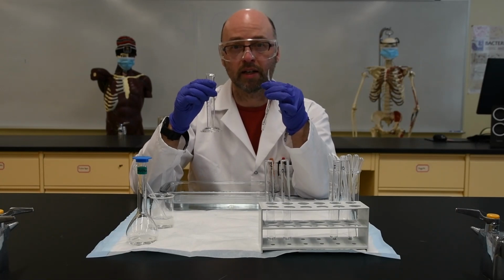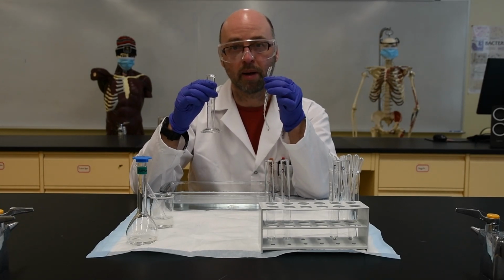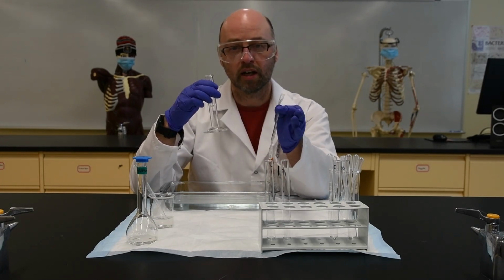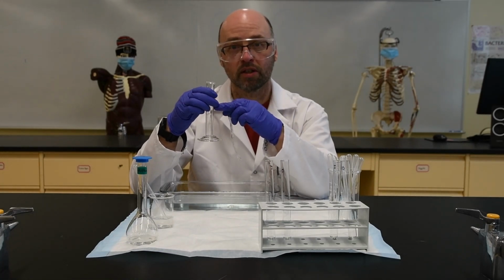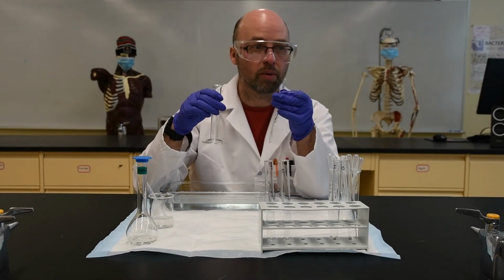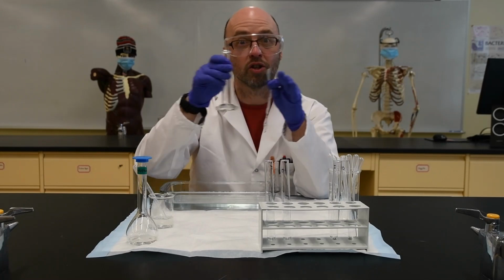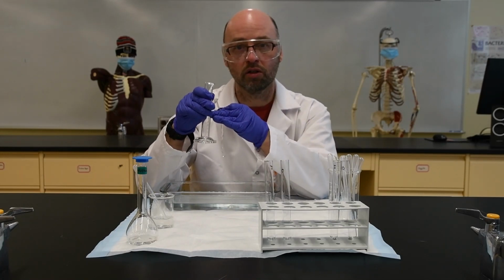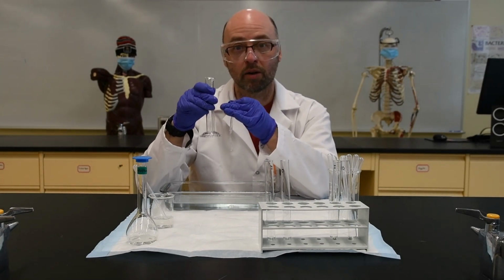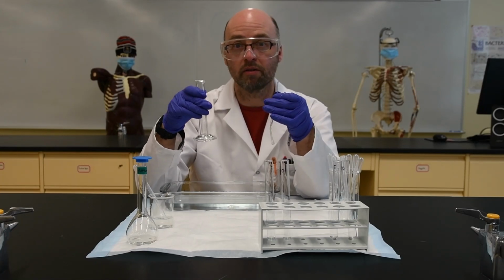And then we're going to wait 30 minutes and we're going to see whether anything can pass through the semi-permeable membrane, because we'll be able to test the inside solution for both glucose and for starch, and we can also test the outside solution, the solution that was in the measuring cylinder itself, to see whether perhaps glucose passed through the semi-permeable membrane down its concentration gradient from high to low and into the outside solution, or perhaps starch was able to pass through the semi-permeable membrane down its concentration gradient from high to low. Perhaps both are able to, or maybe none of them do.